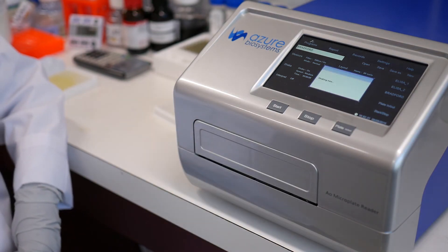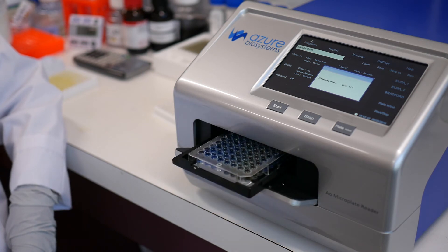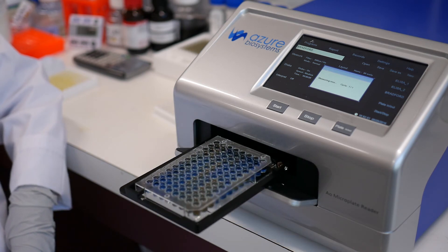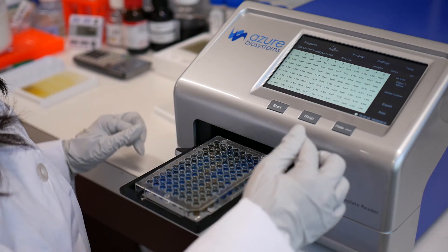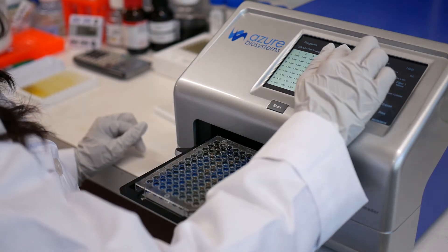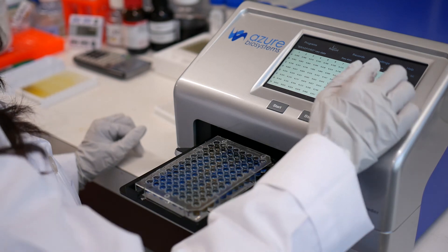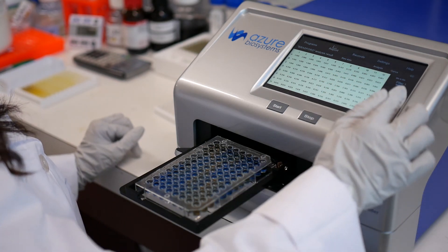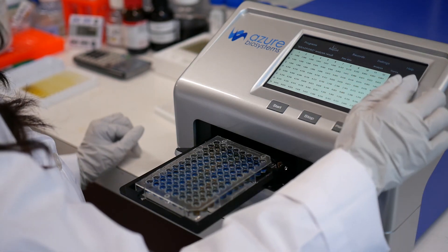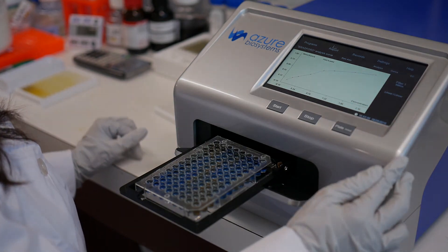With options for fast or normal measurement speeds, you can have your data in as little as 6 seconds. Once the plate is read, the AO automatically brings up the report interface, where you can view your raw absorbance values, analyzed data, standard curve, and QC analysis. Print or export your data directly from these screens with the touch of a button.